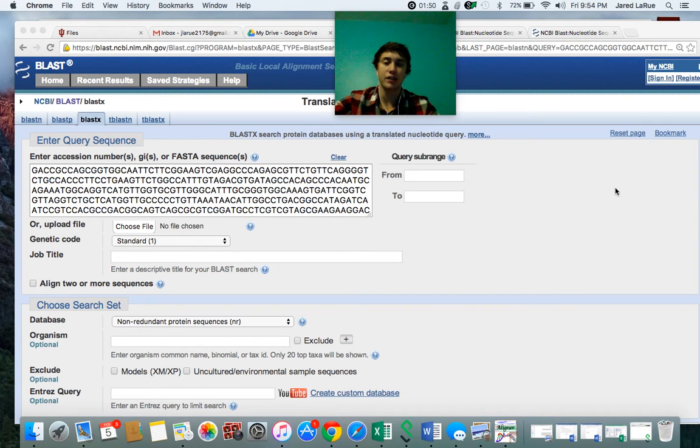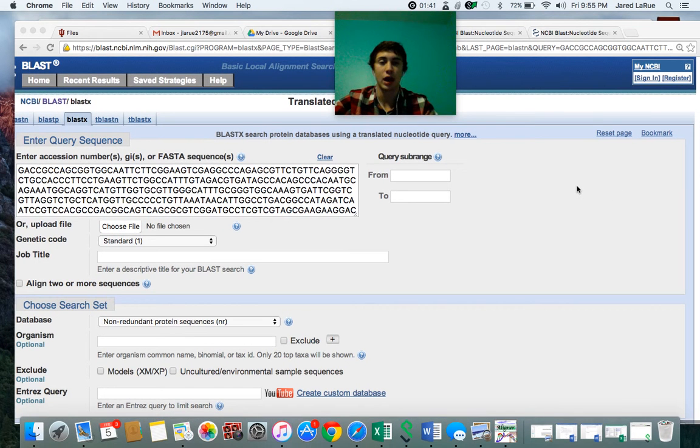If I could give any advice, usually they're pretty good sequences. You just have to go through those errors and figure out which one is right. If there are two or three sequences that overlap, usually if there's an error, it's just because the sequence went goofy in that section. If you're sure that it's off, I usually just change it to whatever the correct one should be, and note to myself that there was an error on that specific part of that sample's sequence. It happens quite often, and that's usually the biggest mistake you have to fix, going through and plucking all of those out, as well as plucking everything from the end.